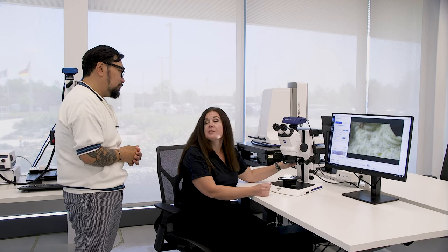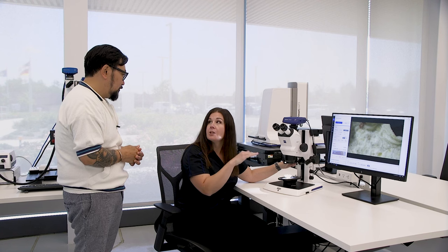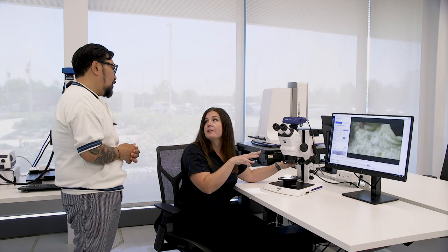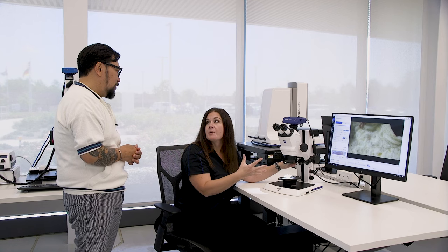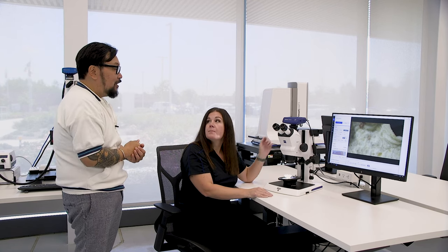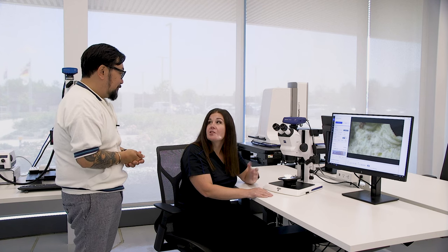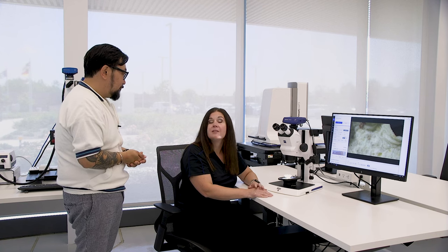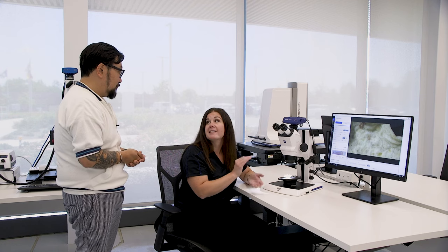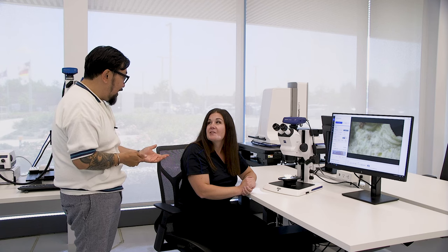Sure, we've come up with a lot of ways to address this. One way is called extended depth of field — we take images at multiple planes and then stitch them together to make one image that's all in focus. You have a stack of images. It does take some time, so we've actually come up with a new technology where we can do this live and see an entire field of view up to 69 millimeters in focus live. Can we see that? Sure, I'm going to show you the Visioner.